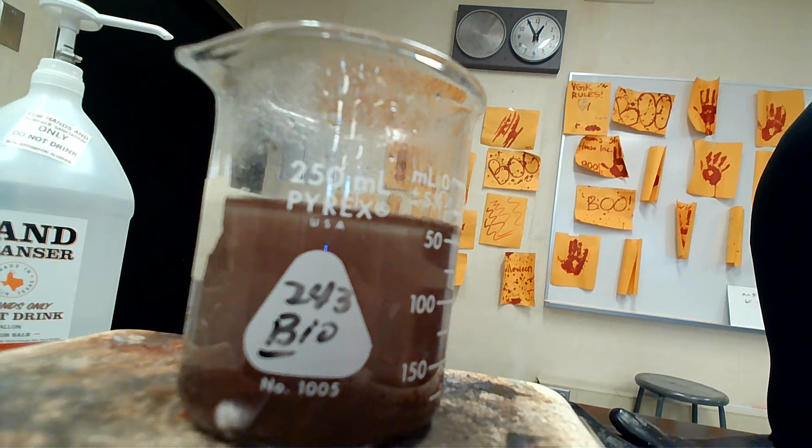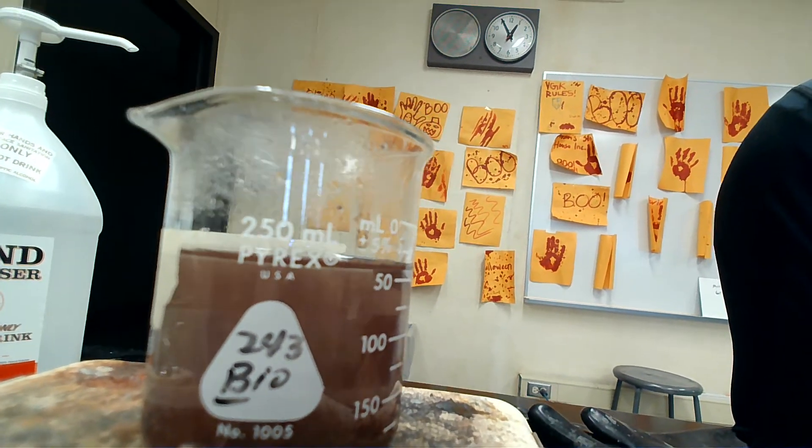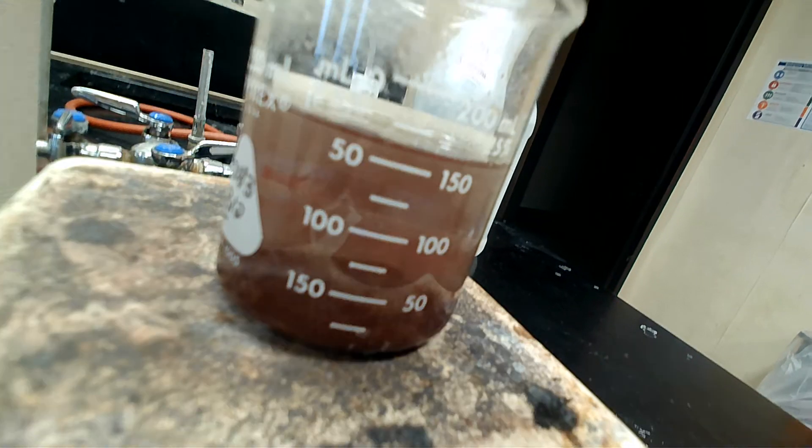Now we want to get that copper out of there. How we're going to do that is called vacuum filtration. It's starting to settle.